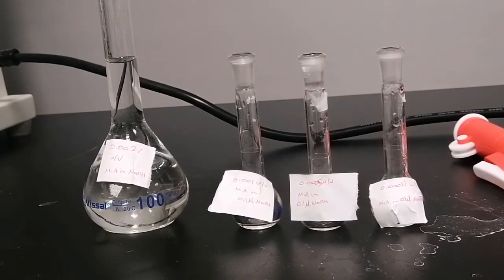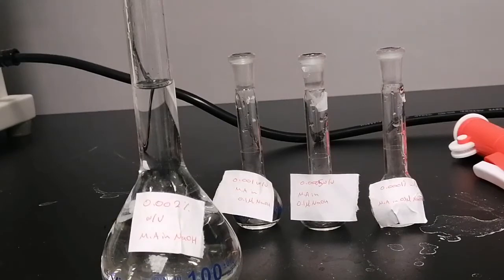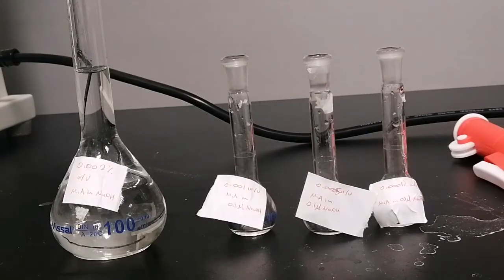Okay. During the shaking process, we have prepared the stock solution for mefenamic acid in 0.1 molar sodium hydroxide. We prepared 0.002% weight per volume of mefenamic acid by weighing 0.002 gram of mefenamic acid and filling up to volume with sodium hydroxide. Then we will prepare further solutions in order to measure their absorbances, and as we already know, the calibration curve requires only knowing the concentration, and the absorbance is already observed by the spectrophotometer. Then you can calculate the absorptivity of mefenamic acid, and the absorptivity won't differ as long as you're working at the same lambda, which is 287 nanometer.